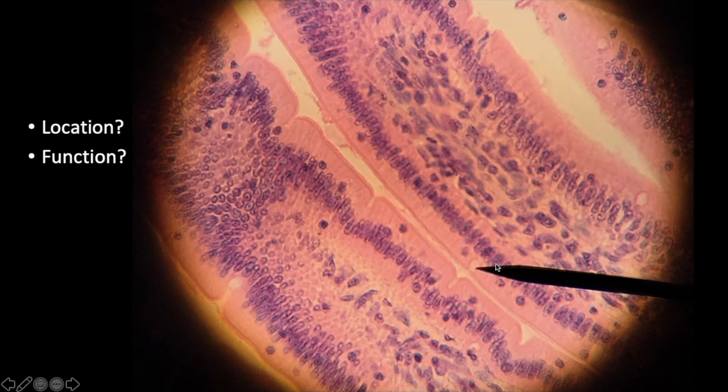Okay, very good. What we're looking at here is one cell. Check this out. I can start by looking at these nuclei, very neat and organized. If I were to outline the plasma membrane, it would go like this: a very, very long, slender box, almost like a column.